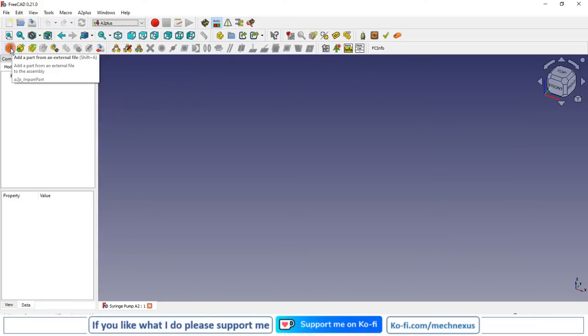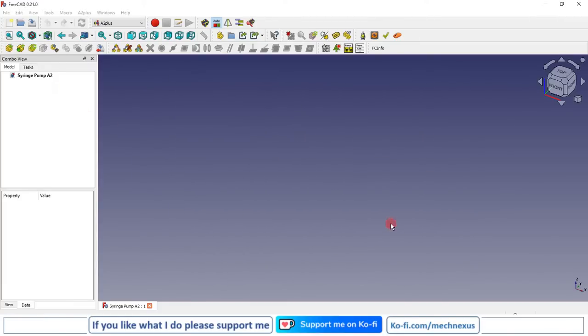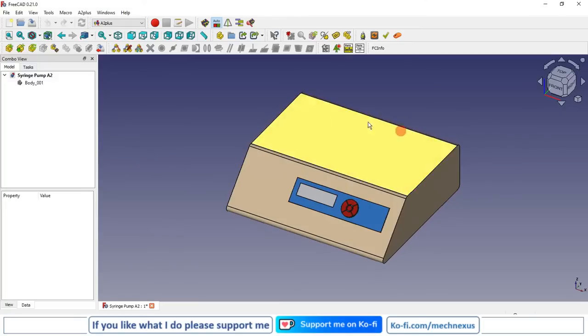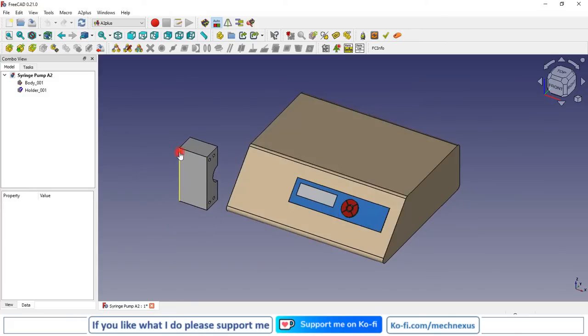So first part we are going to add is a body. So from my folder I will insert the body. So body has been inserted. Now I will insert holder and I will place it. Now we will give constraint between this body and holder.